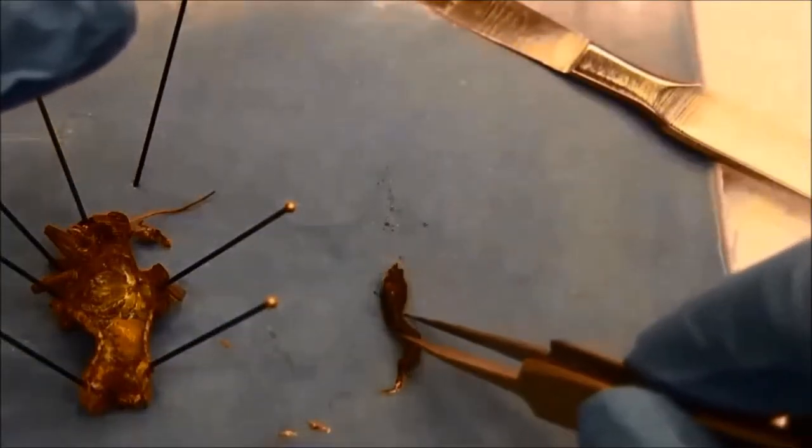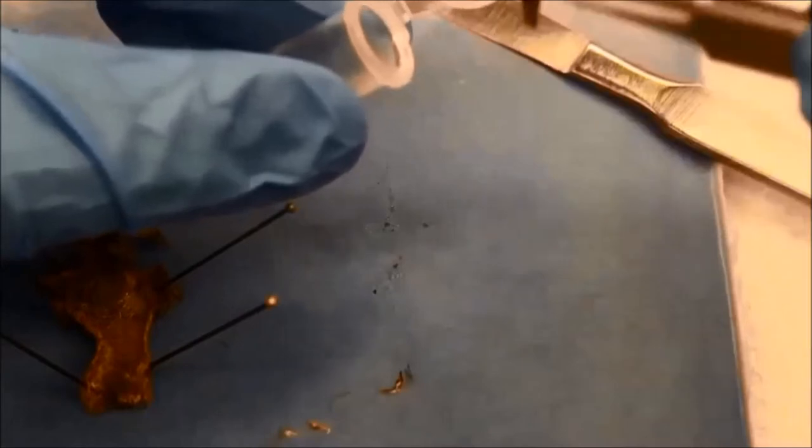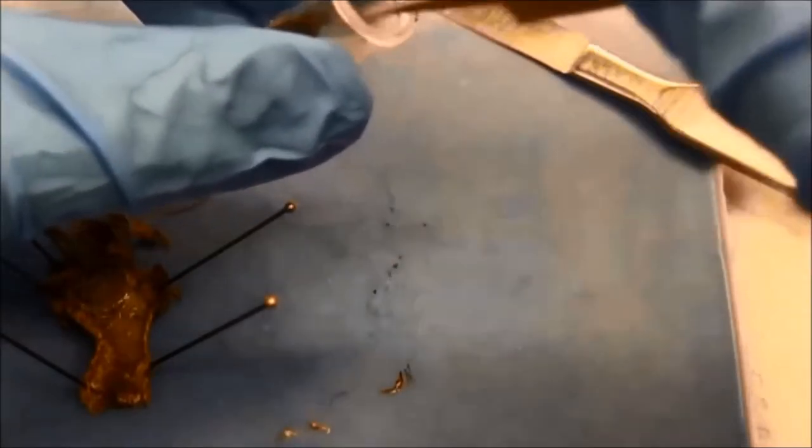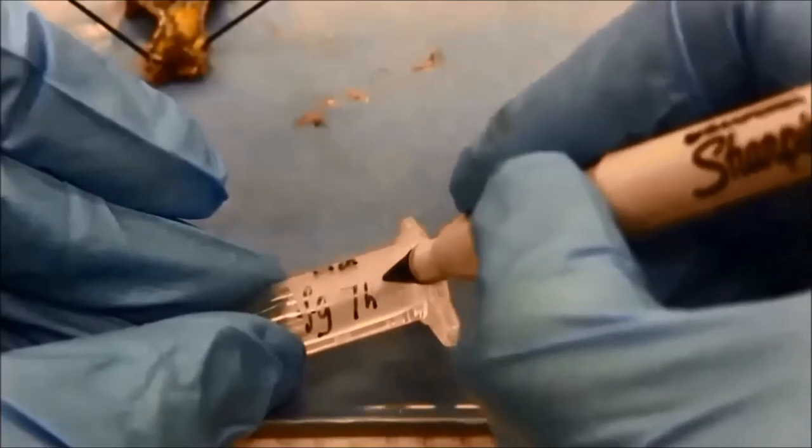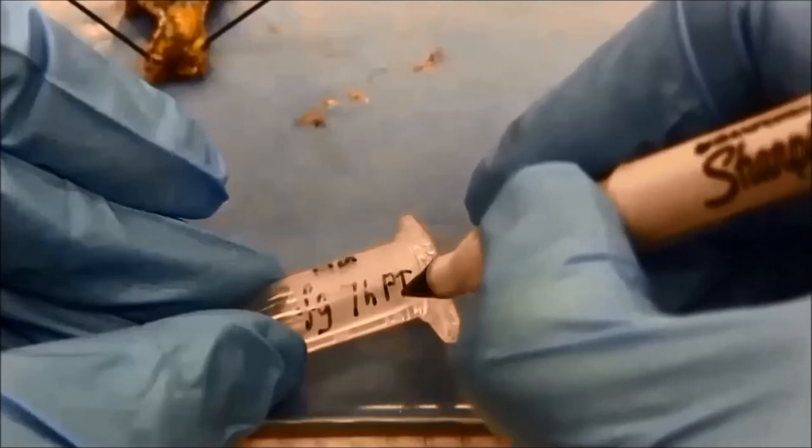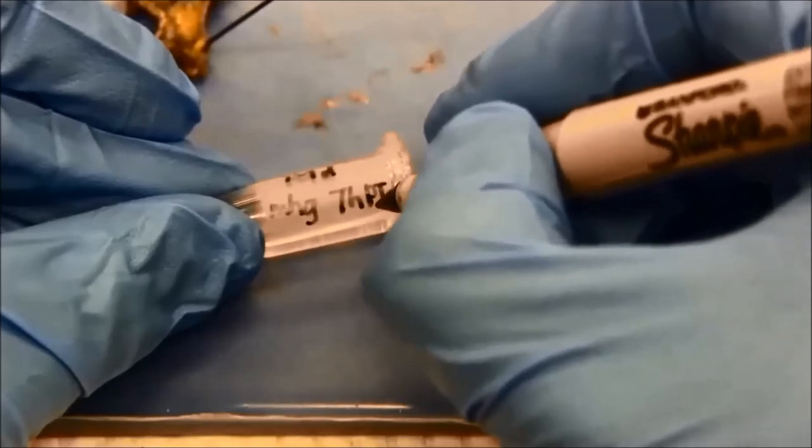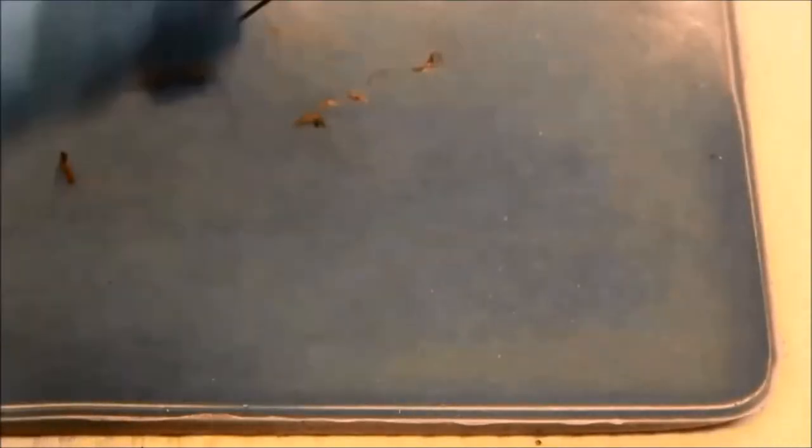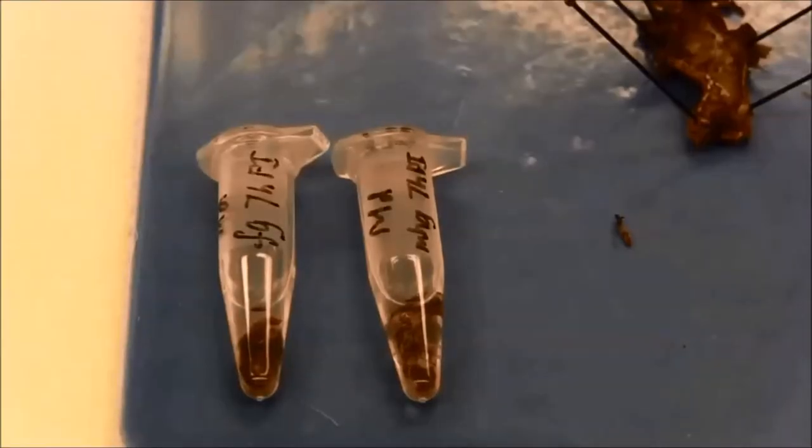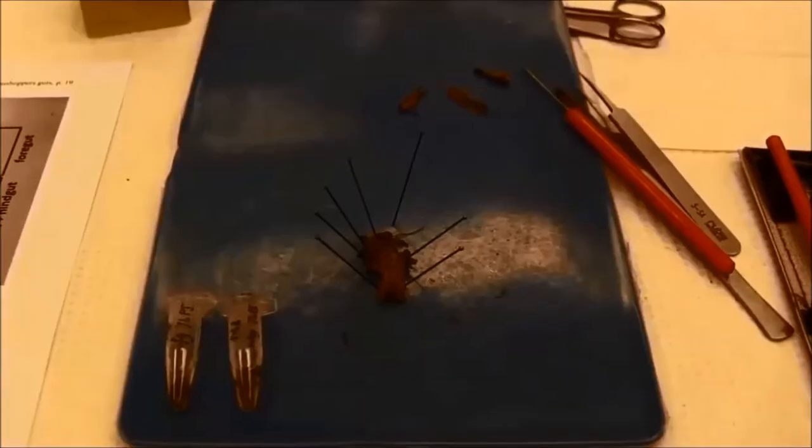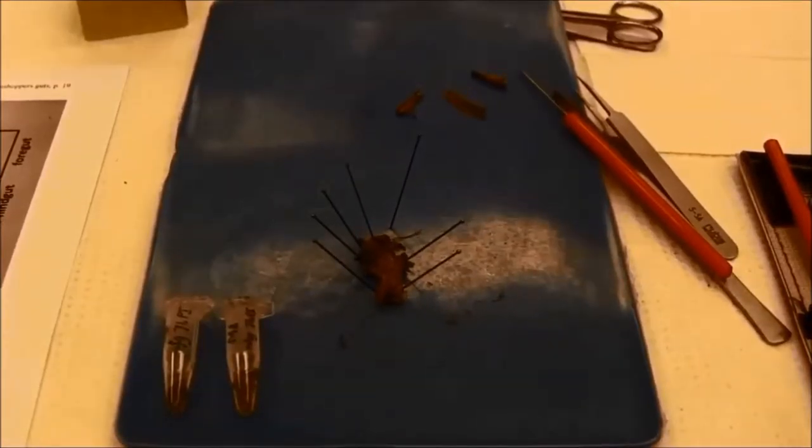You can skip this step if you immediately proceed with DNA extraction. I label the tubes. This was a differential grasshopper after 7 hours post-ingestion. Now the tubes are ready to be stored in the fridge till the next DNA extraction step.